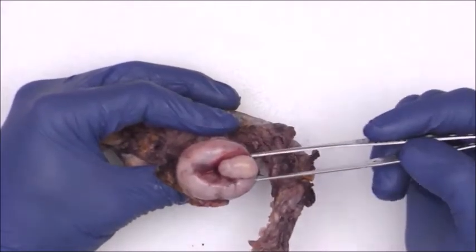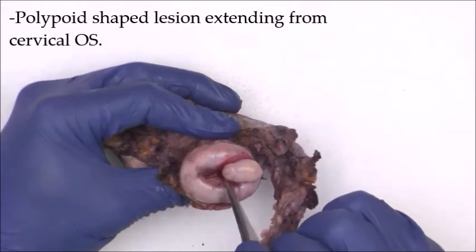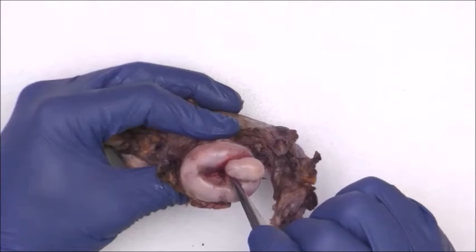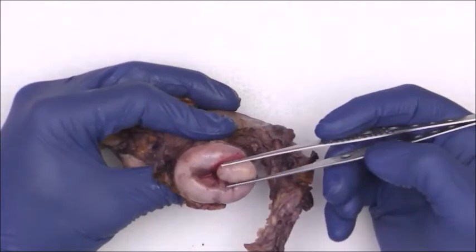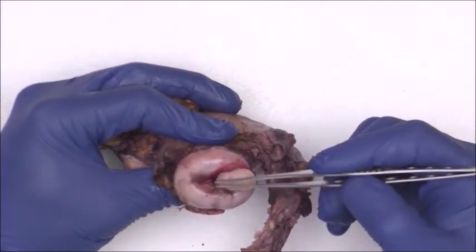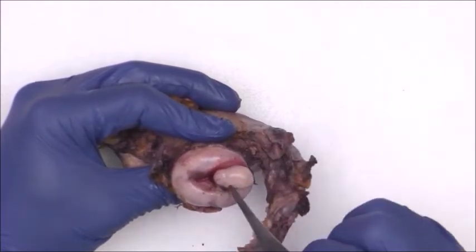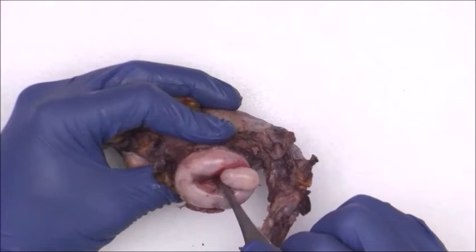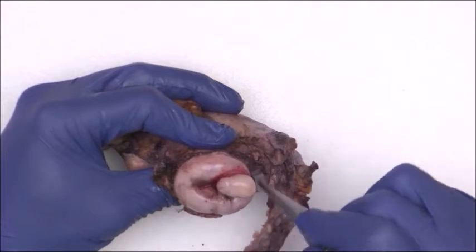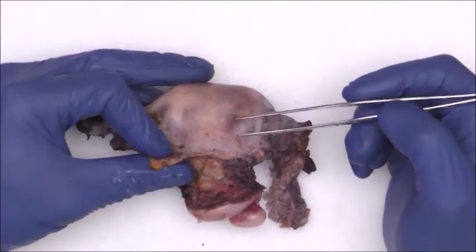And as you'll see, extending from the cervix, it looks like it's right at the ectocervical-endocervical junction, is this polypoid lesion, which is most likely benign. It's got a very well circumscribed border. It's rubbery. Once again, this lesion is right at the ectocervical os. Here's the ectocervical mucosa.